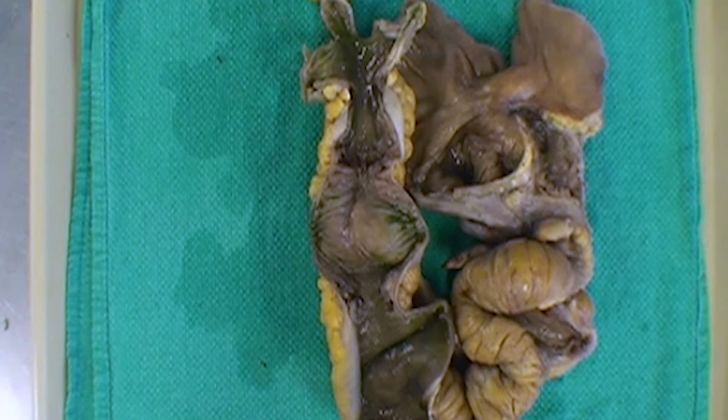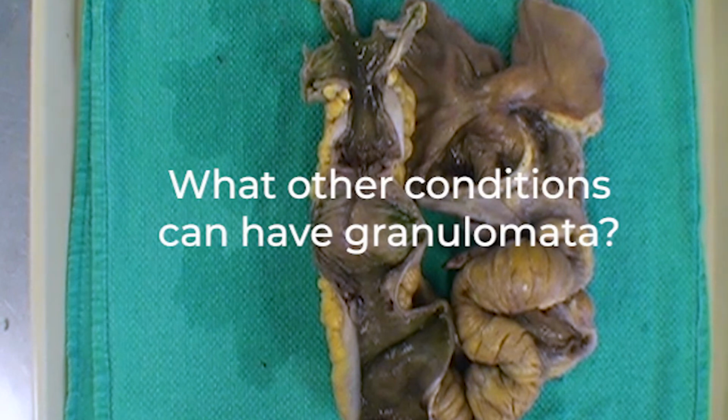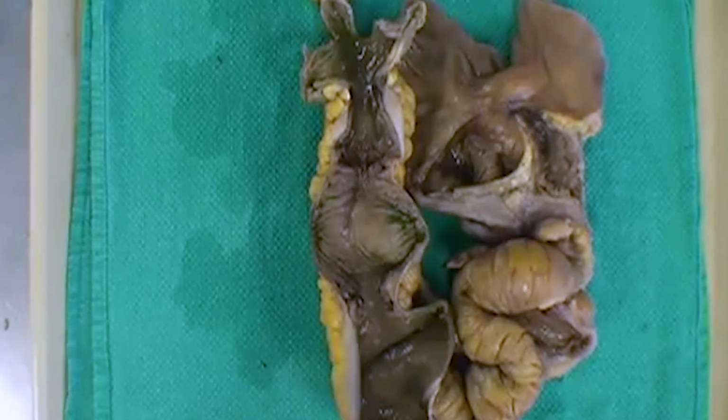The key take-home message here is that if you see granulomas, it definitely helps you to support a diagnosis of Crohn's disease. But if you don't have them, that doesn't mean it's not Crohn's disease, because about half of Crohn's will just not have the granulomas that you see. Furthermore, it's also important to recognize that other conditions can give you granulomas. Does anyone have any thoughts on other conditions that can give you granulomas or granulomata in the colon?